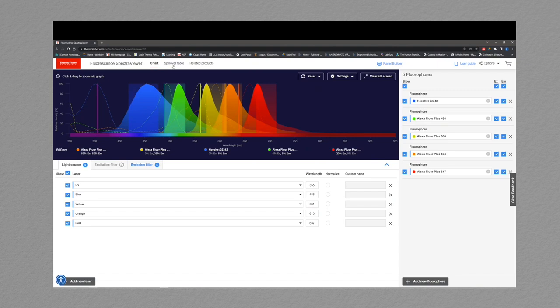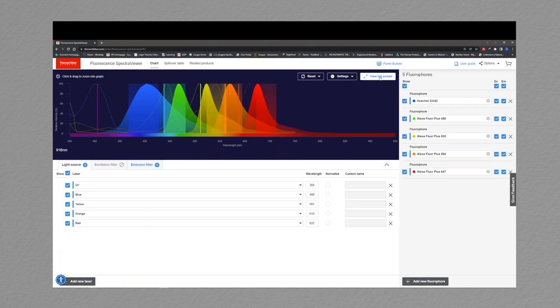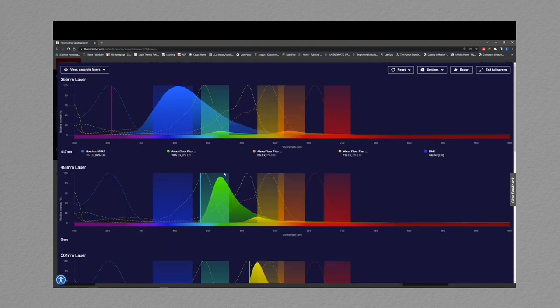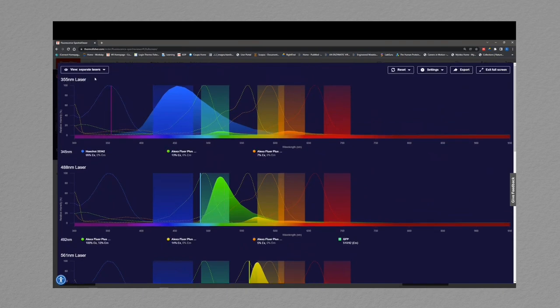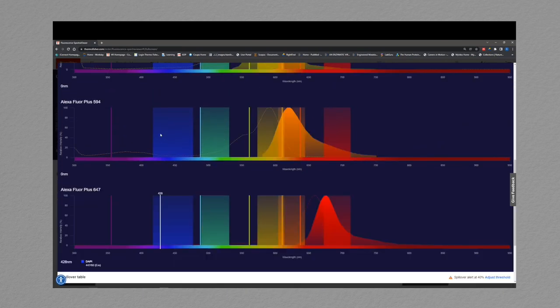You can either simply click this button up here, spillover table, and it'll show your spillover table. Alternatively, you can go into the view full screen mode, and you can see your spectra above with your spillover table below. And this is my preferred method because I like to see my spectra above the spillover table. Additionally, you can separate your lasers and have a spillover table at the bottom, or you can separate out your fluorophores. And again, your spillover table will be at the bottom.